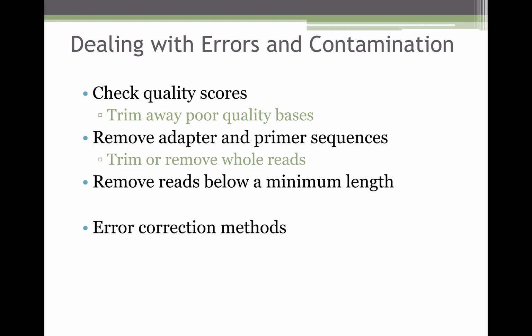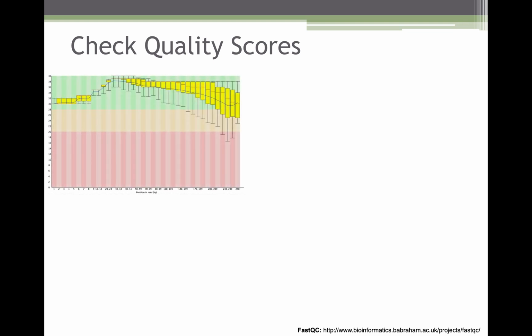So how do we deal with all these errors? By now we know what are the typical errors that you expect in a particular NGS platform, and then you can look for those errors. And if you find evidence of those errors in your data, you can try and remove those. One of the tools that is commonly used to look at the overall quality of the NGS data is FastQC, and it gives you various metrics. One of the metrics is a box plot of the quality scores. You have quality scores on the y-axis and read length on the x-axis, and it's also color coded.